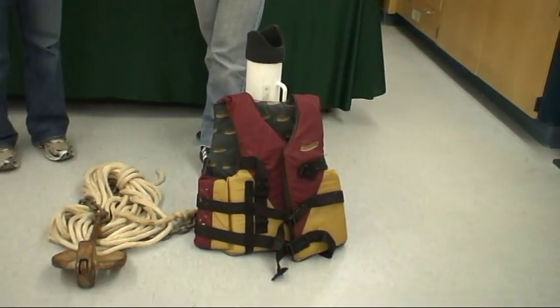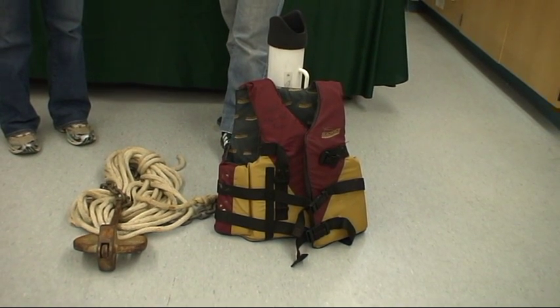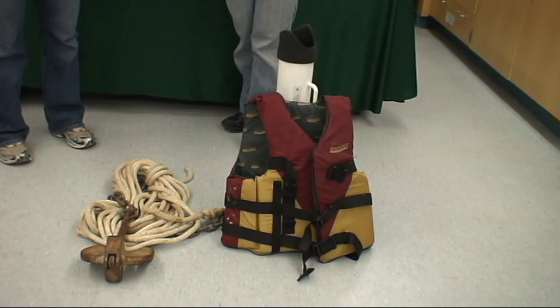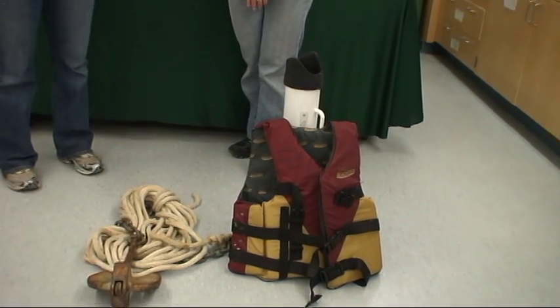You are now ready to sample, so hop aboard your boat. Make sure you take life jackets and an anchor with a long enough line to hold you at the deep spot — we'll be there for a while. It is important that while collecting your deep spot samples, you don't drift out of the area. If you do drift out of the deep spot, please reposition the boat to be back at the deep spot so you can continue collecting your samples. We recommend collecting your deep spot samples first and then moving on to the tributary portion of sampling.